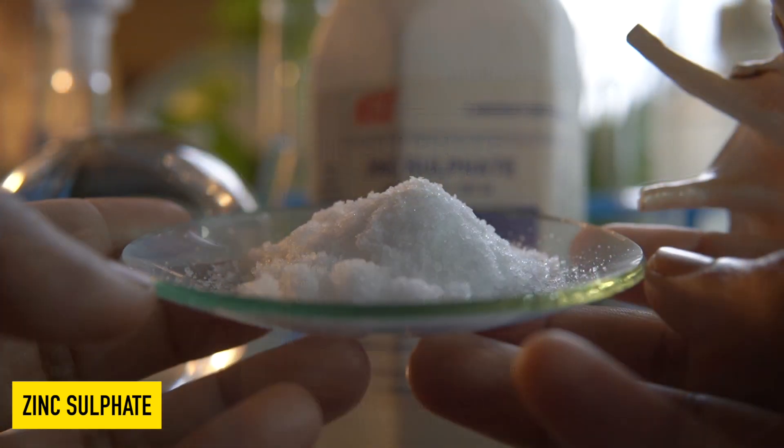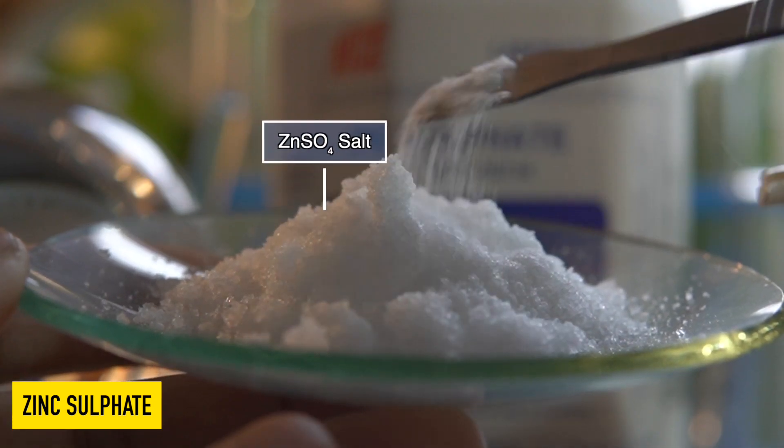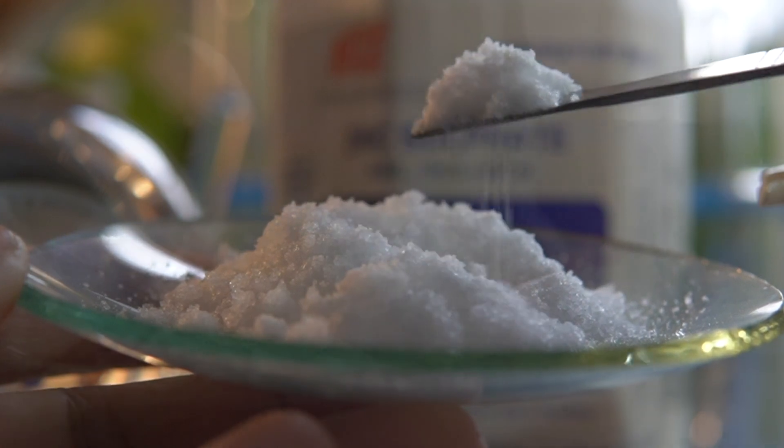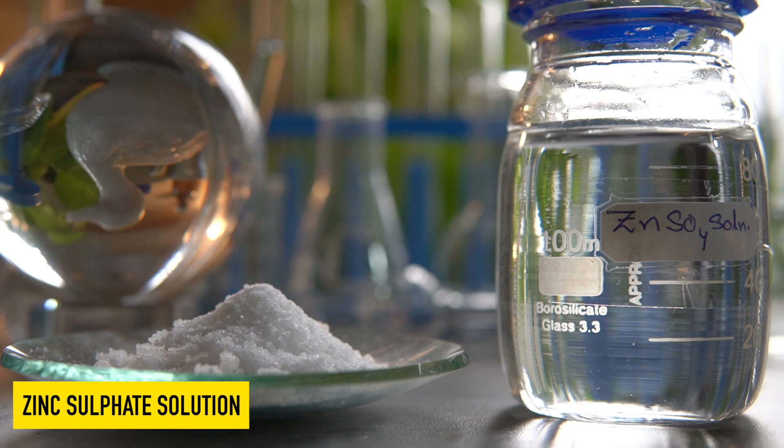This is zinc sulfate heptahydrate, a white crystalline salt and highly soluble in water, so it can easily dissolve in water to make a clear solution.